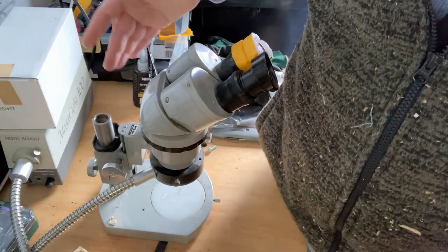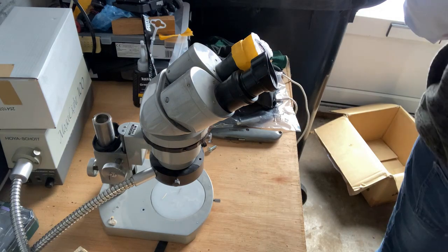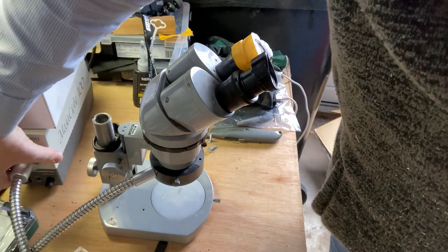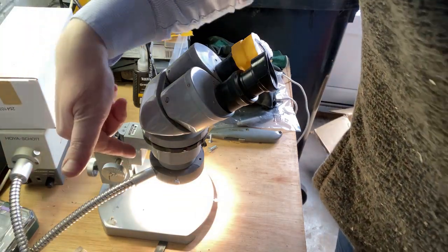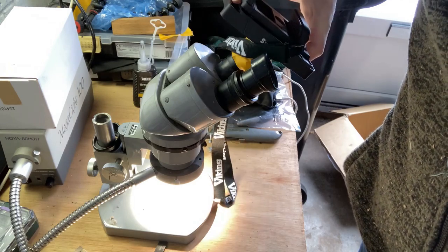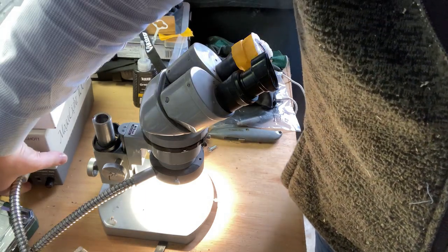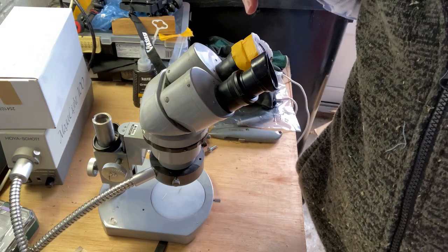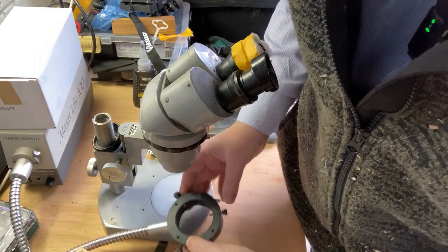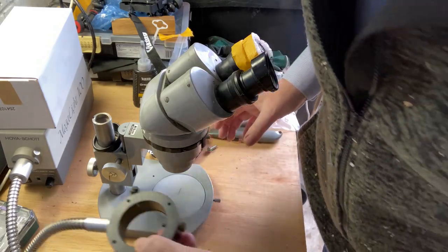So first things first, this is the light source, and if I was just to switch this on, I can actually put my light on here. That's a ring light. I have my camera capture set up on here, which I've still to make an adjustment for, and I can then view the object through the eyepiece. So first thing first, I'm just going to take that off, and it's pretty straightforward. It's just three little screws that lock it in place on the base here.